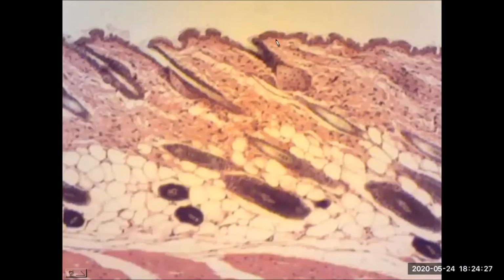So we have this darkened, stained edge. That's where we're seeing the epidermis. We have this pink staining here, the connective tissue layer, the collagen, and the dermis. And then you can already start to see the adipose tissue. You should be able to recognize that sample, and that's where we have the hypodermis.